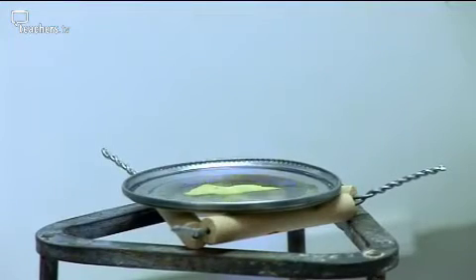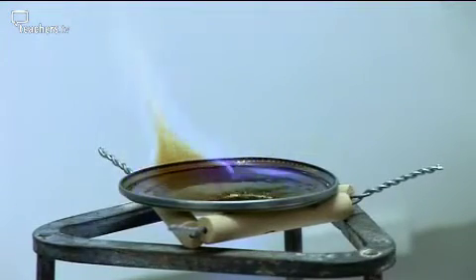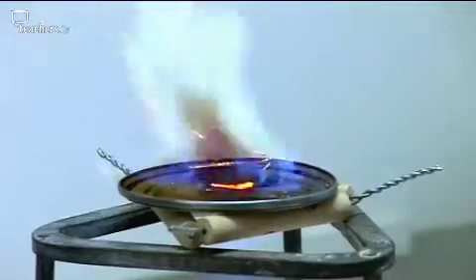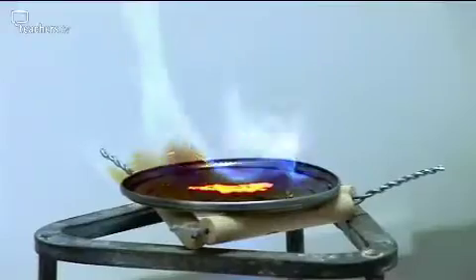OK. The sulphur's just caught light, the blue flame. And that means the sulphur's burning in the air, so you're getting lots of sulphur dioxide, which is a toxic gas. And there's the reaction between the iron and the sulphur. And if you were doing that on an open bench... It's hugely dangerous. Very dangerous, yeah.